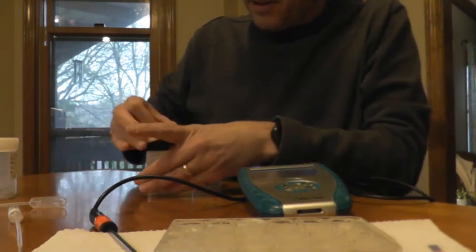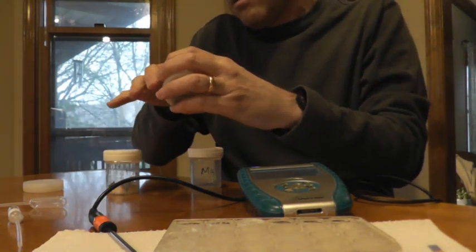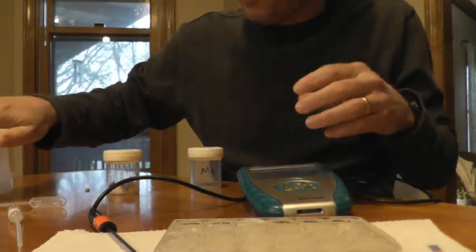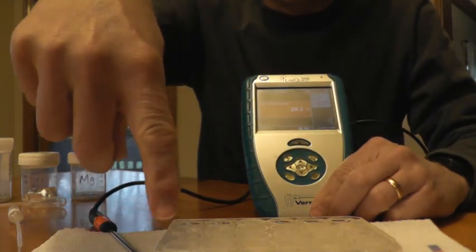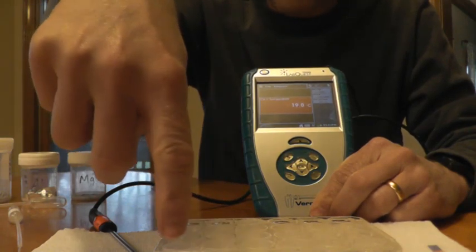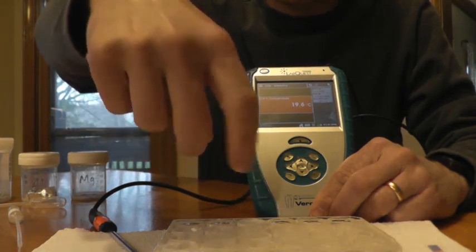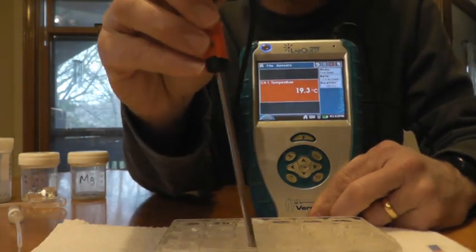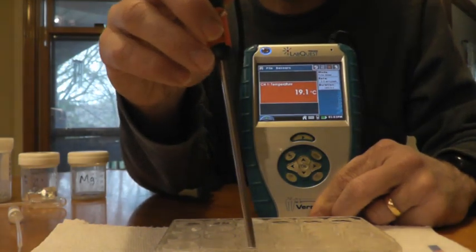All right, and last we'll put a piece of calcium in there. And this one should obviously be more, but the main reason we did this one was just so you could see a difference between our row. Again, aluminum, magnesium on the same row. There was no difference here, but now we see that aluminum is reacting less than the magnesium, all right? And we already know from up here that if we're looking down a column, the further down we go, it seems to be more reactive. So once again, stick the temperature probe in. Looks like we're starting about 19.2.